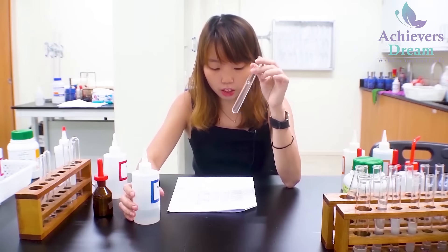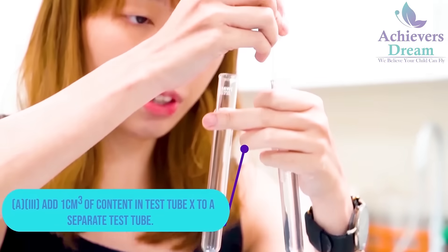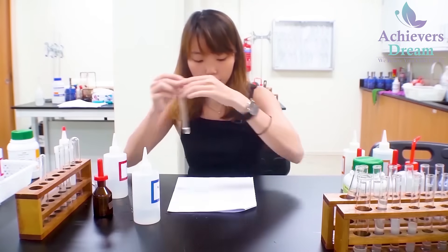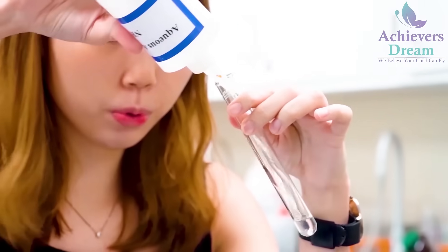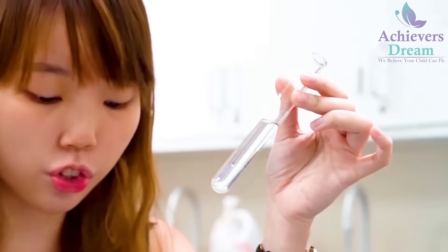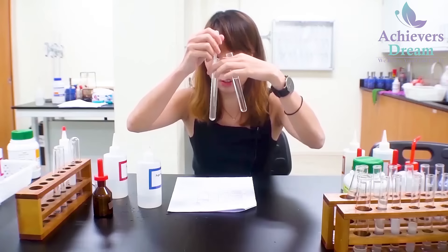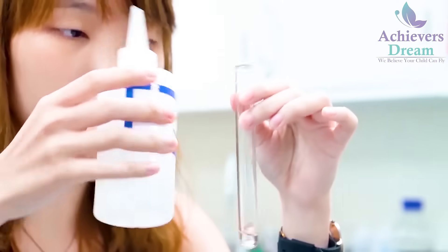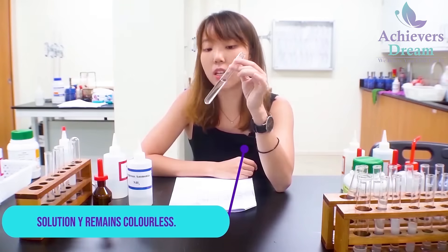For part A3, I'm going to add about 1 cm³ of the contents of test tube X into a separate clean test tube, then add aqueous ammonia with shaking until the test tube is one-third full. The solution remains colourless — there is no visible change. I'm going to repeat for salt Y: transfer about 1 cm³ to a clean test tube and add aqueous ammonia until it is one-third full. The solution still remains colourless — no visible change.